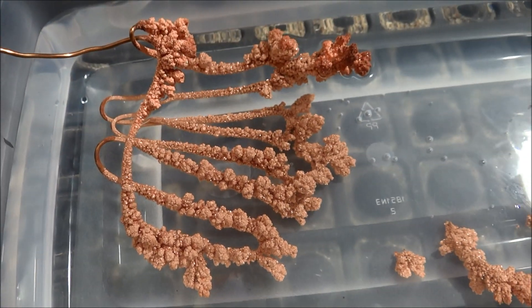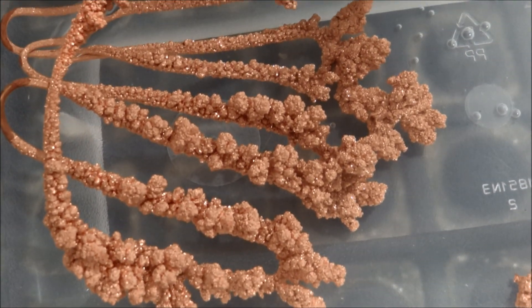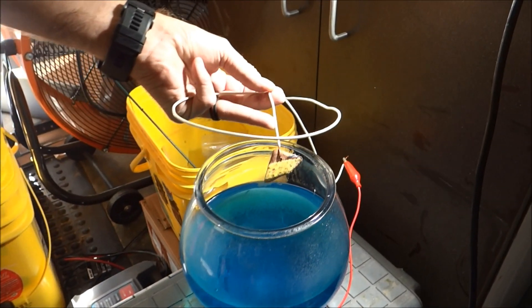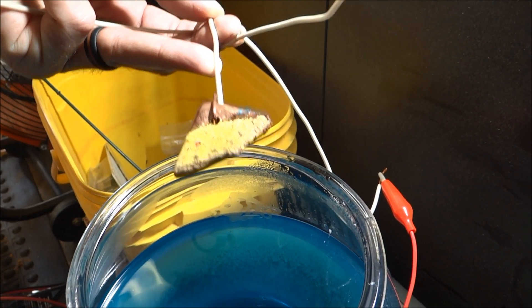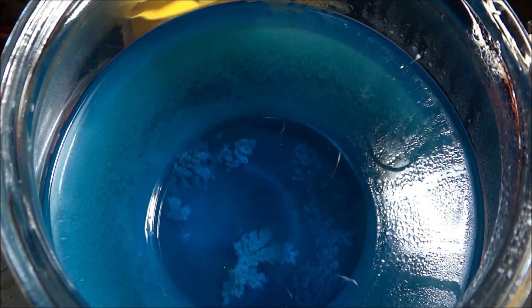And then the anode - there's not much left of that either. Copper crystals - look up here. That's what's left of the anode, my copper bar. And if you look down in there, there's more copper in there - the parts that broke off - and then all the impurities from this bar.